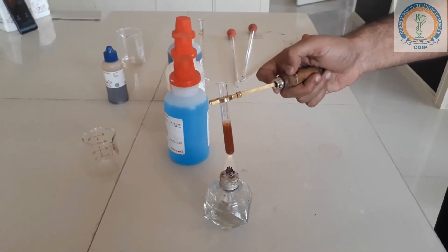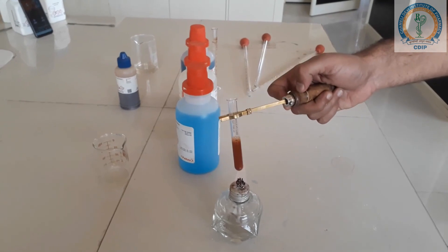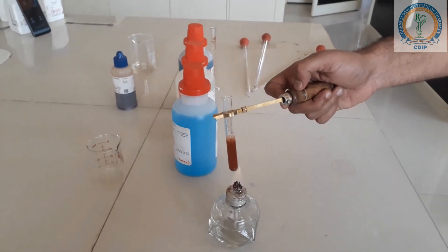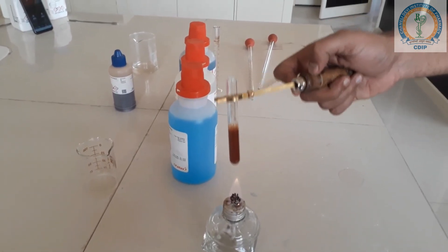On boiling, you can see here the precipitate of red color.